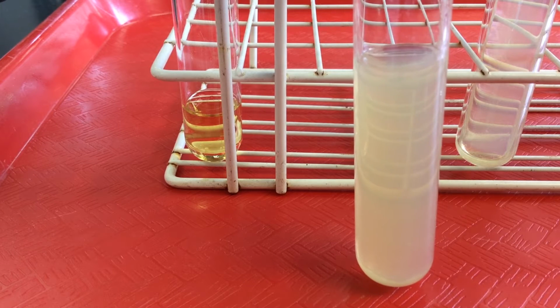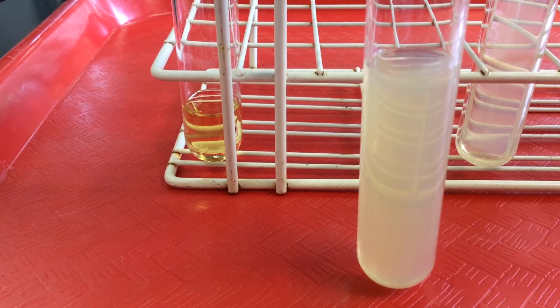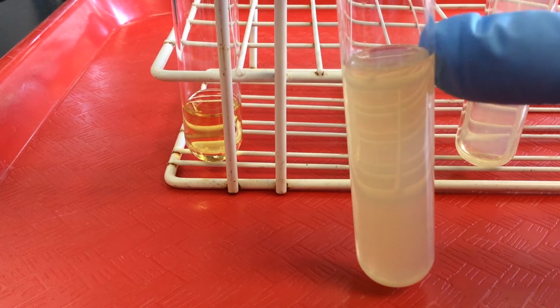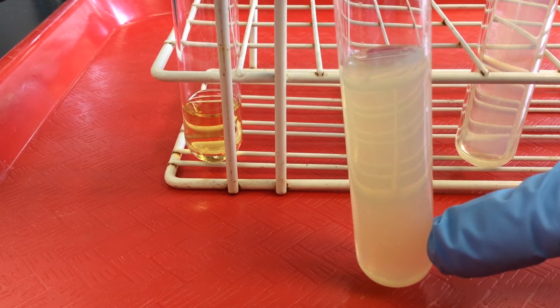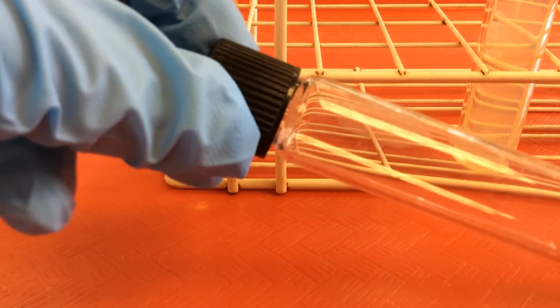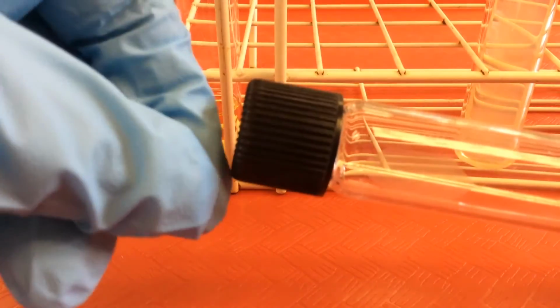Agar deeps can be used, for example, to see if microbes can grow anaerobically. Anaerobically means without air. What we might do is, using a needle, stab or inoculate our bacteria down into the very butt or bottom of this agar deep and then incubate it and see if the microbes can grow anaerobically. Again, we always want to remember that when we're growing microbes using these agar deeps, we barely loosen the cap so that they can vent.